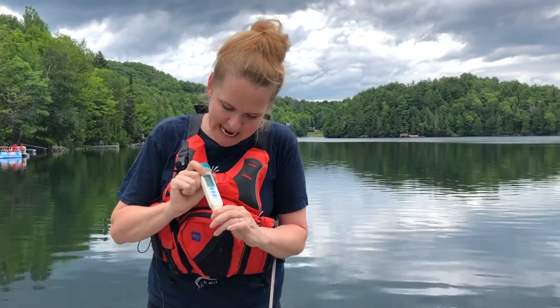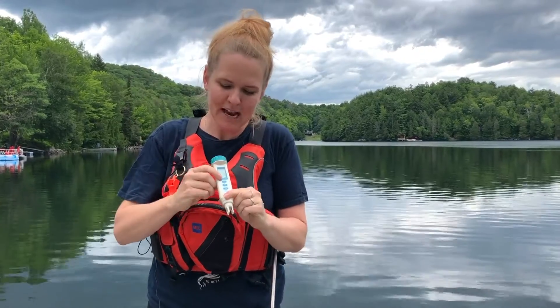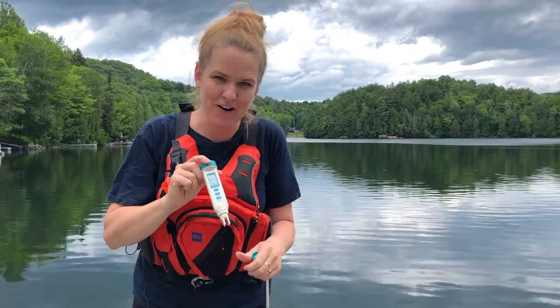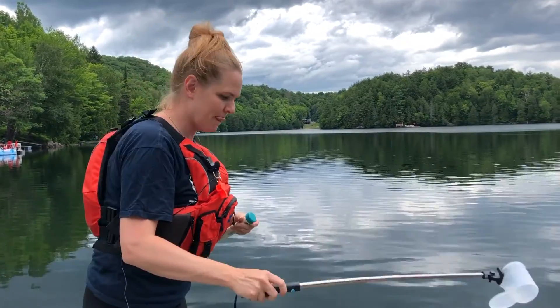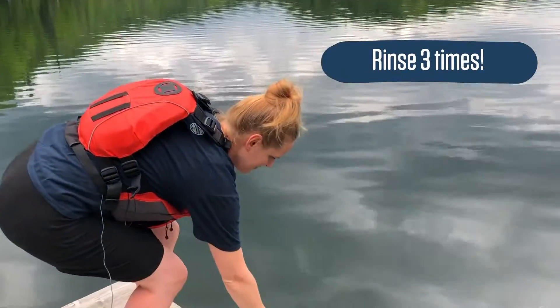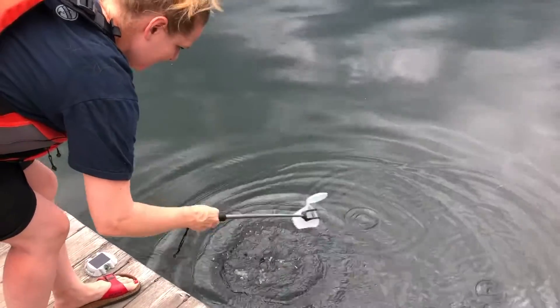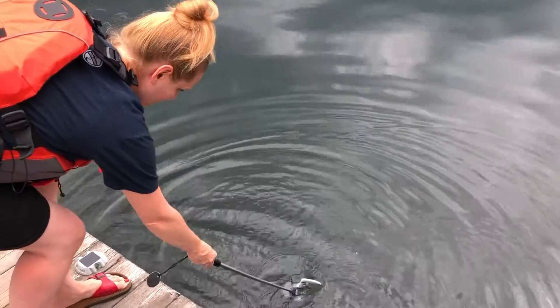To do this test, I'm going to remove the cap. I press the top button once to turn it on, and once it's on I'm going to get my sample. I'm going to rinse my cup three times in the water I'm going to be testing, and then take my sample 10 centimeters below the surface.